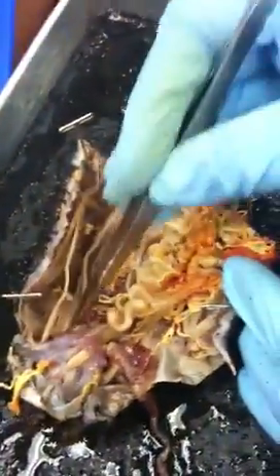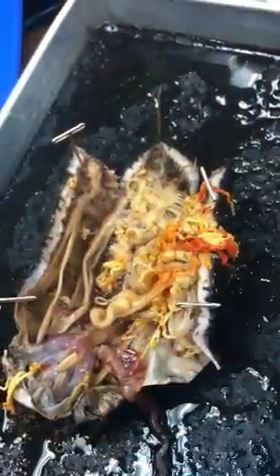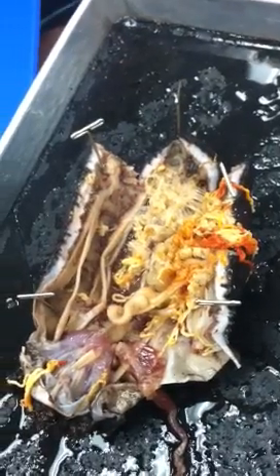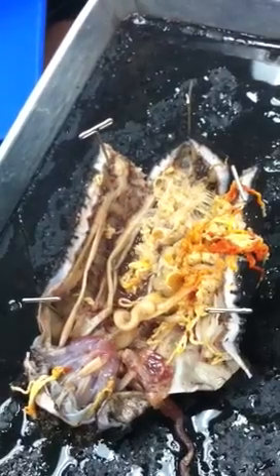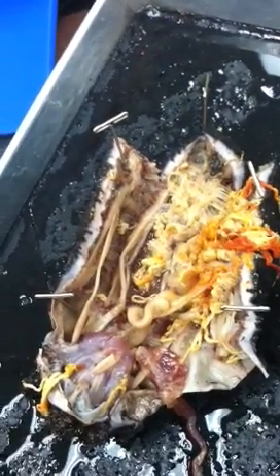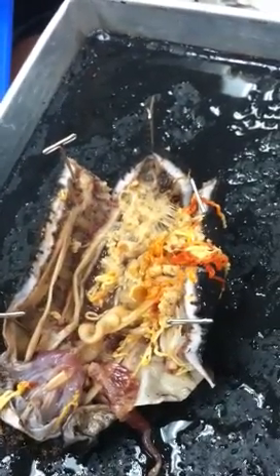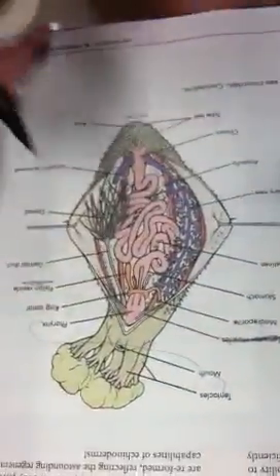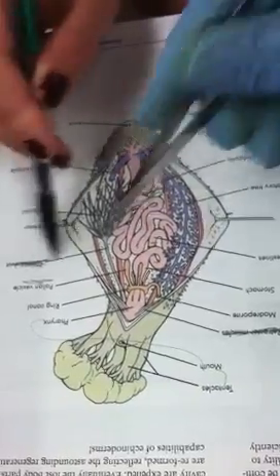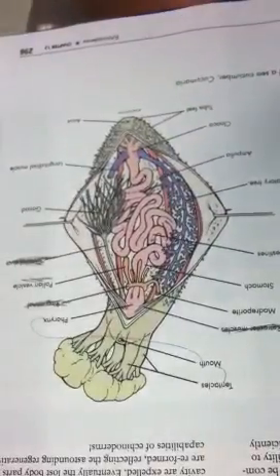Anyway, so these long muscles here are called the longitudinal muscles. They just run the length of the body, and they help them to move in addition to the tube feet. Look at my picture. Yeah. So it's pretty similar to this picture in your book. The only thing, you don't need to know the retractor muscles, and you don't need to know the genital duct. And I'm not going to ask you the ring canal because you can't really see it, but it is in there. You can see the Polian vesicle.